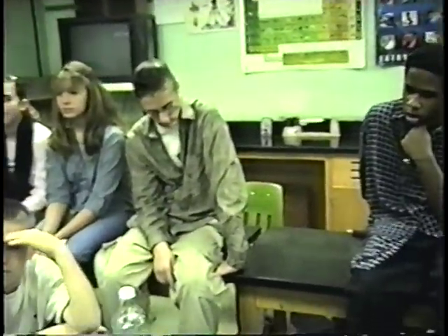So my next question to you is, how come it's even? Why did it come out to be equal? Yes? Law of conservation. Yeah, you're proving the law of conservation of matter. Now, you know from our discussion a little bit earlier today that we talked about groups that got a weight that came out to be less. What would have caused the weight to be reduced? Because of the bubbles. Yeah, the gas that was coming out.